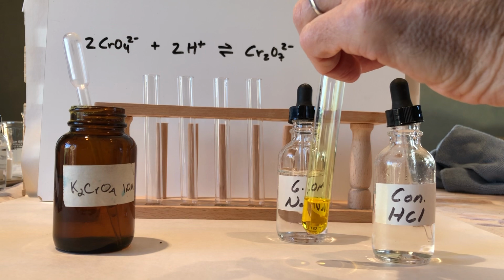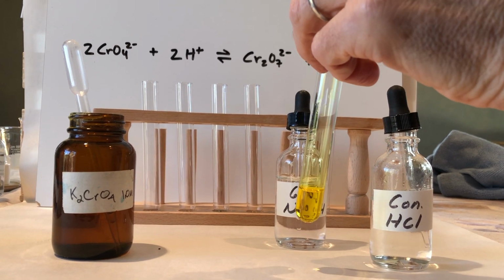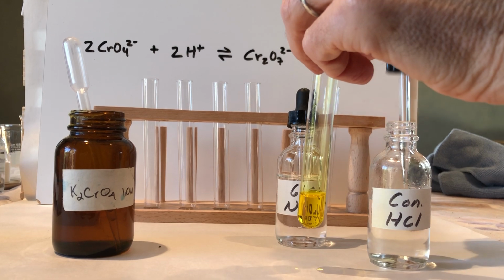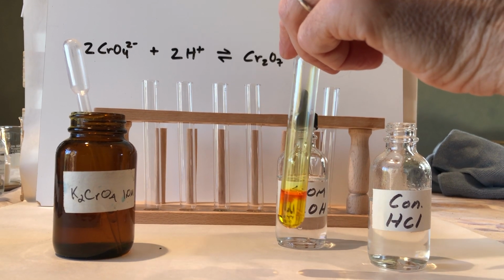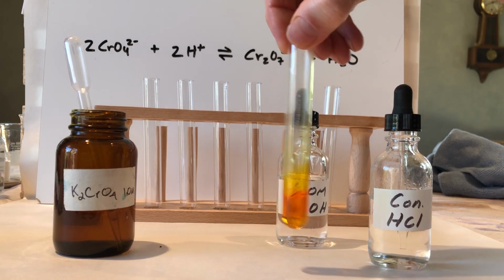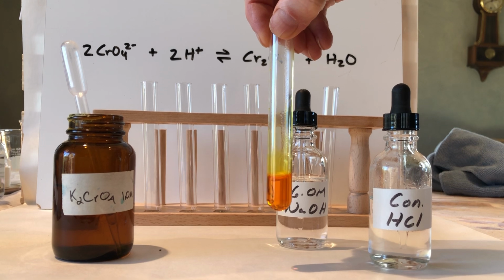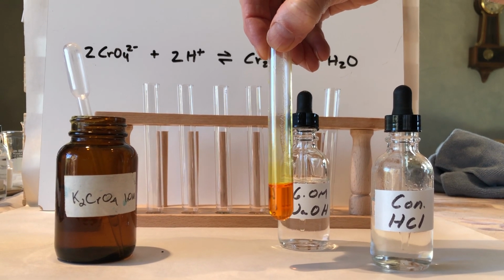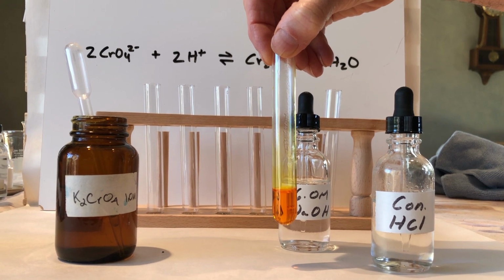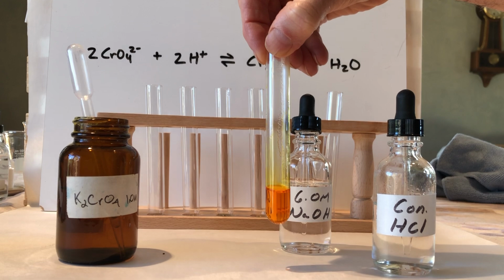And then we'll do one more thing. We've disturbed the equilibrium system twice, reestablished equilibrium twice. We'll one more time add hydrochloric acid. So a couple, 3 drops of hydrochloric acid. And once again, we've changed the equilibrium system in response to a stress. Once again, explain what is going on. And then we could conceivably keep on doing this for a while, but we'll stop after these steps.